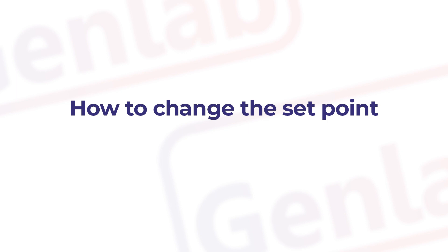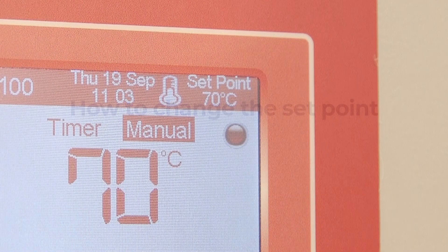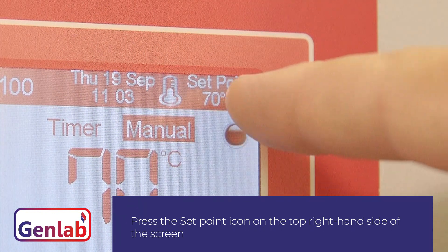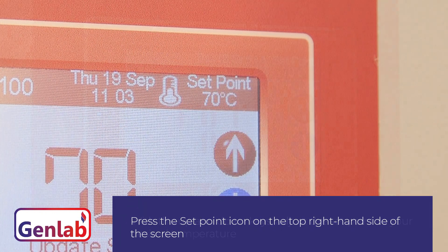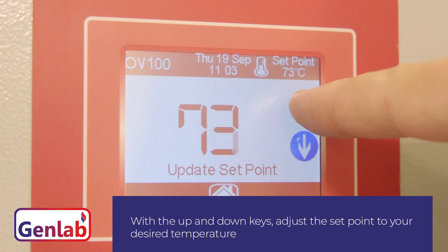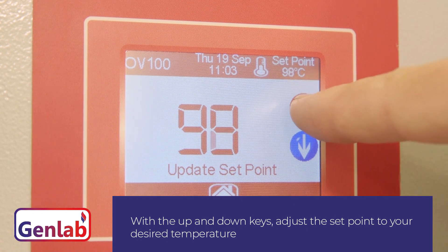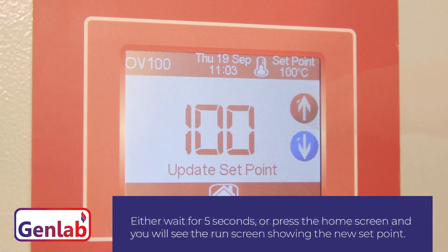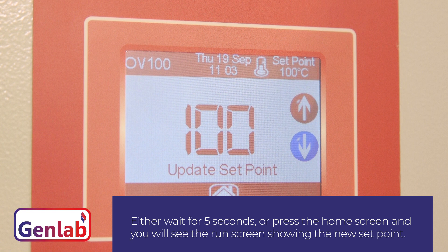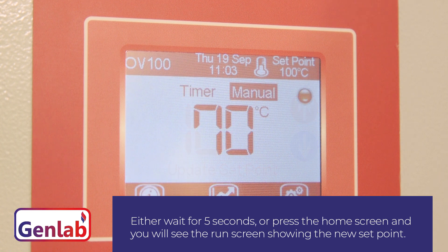Changing the set point is done in three steps. Step 1: press the set point icon on the top right hand side of the screen. Step 2: with the up and down keys, adjust the set point to your desired temperature. Step 3: either wait for five seconds or press the home screen button, and you will see the run screen showing the new set point.